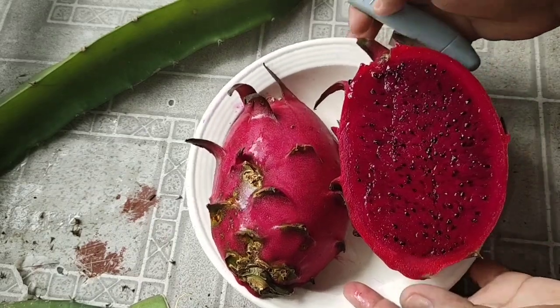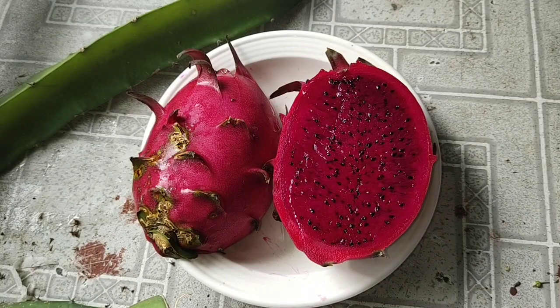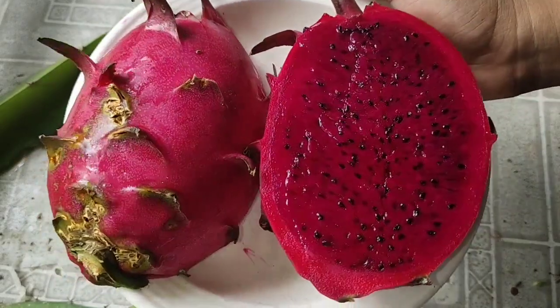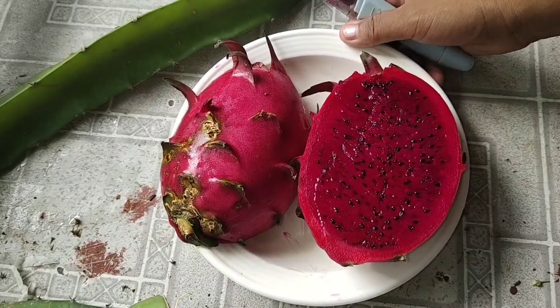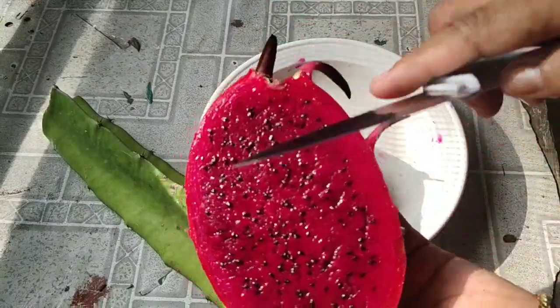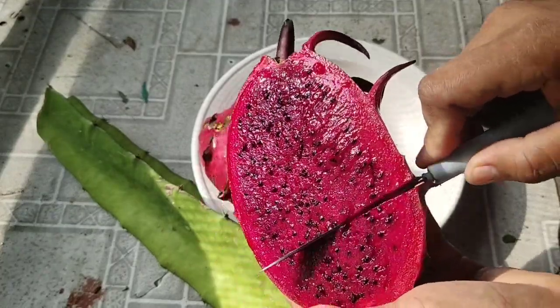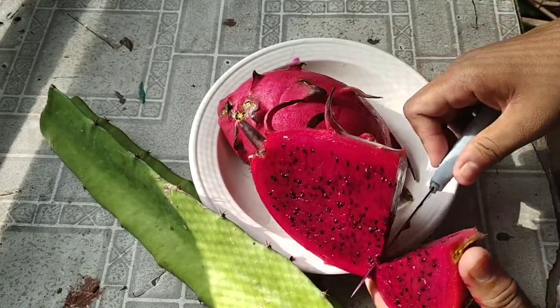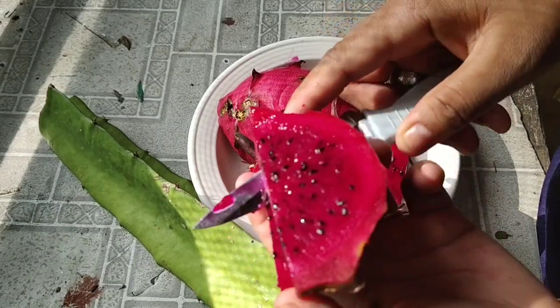This is it — isn't that pretty? It's really red. So we're going to go ahead and do a Brix test. Let's also go ahead and taste it to see how it tastes. This is already cold from the fridge, so let me just slice it and taste.